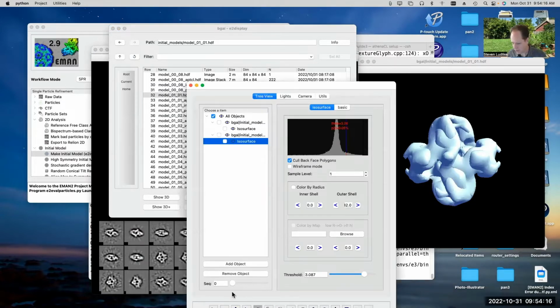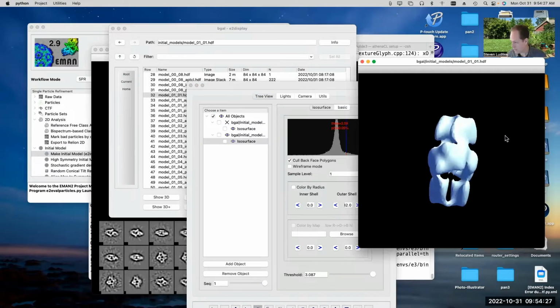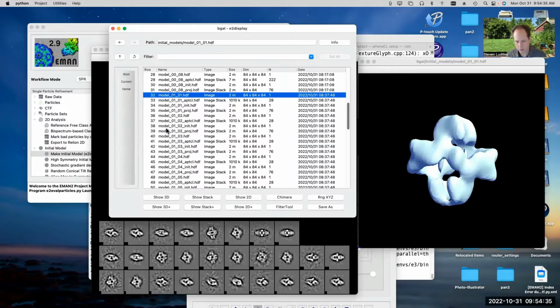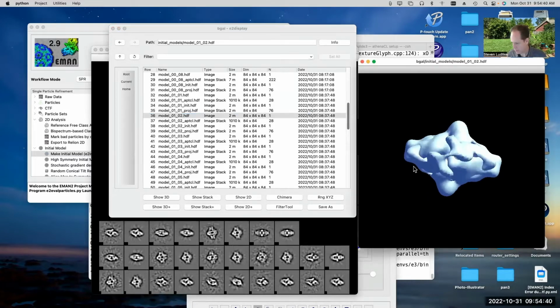All right, it doesn't actually look all that different from the one that we got out of the first run. So this is the one we got from the first run, and this is the one we got from the second run. And I know that this particular class average is not really a very good one. Let's see what it looks like when it is good. The second one we got out this time is actually a very nice initial model.